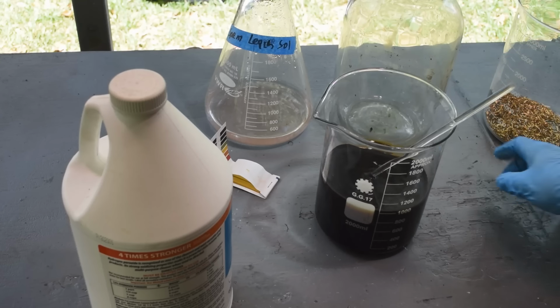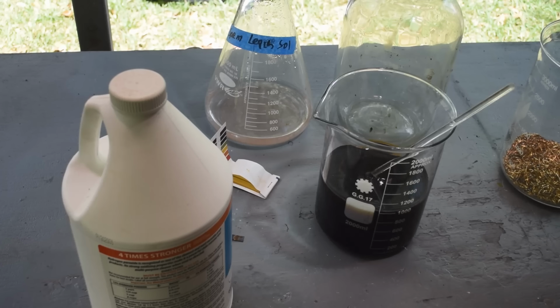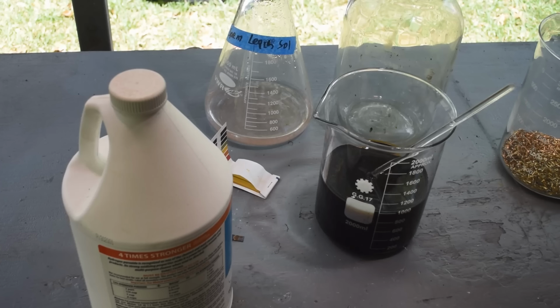The pH, Altec is recommending slightly alkaline. I think it's kind of tickling the dragon's tail, and you're probably going to have a lot of metal hydroxide crash out of solution on you before you really want them to, but you never know. I'll try his new recipe at some point, but I have a lot invested in this one, so we're going to go with it for now.